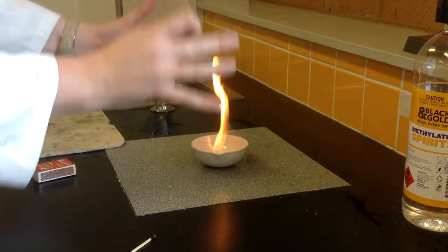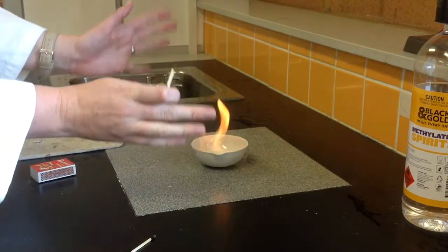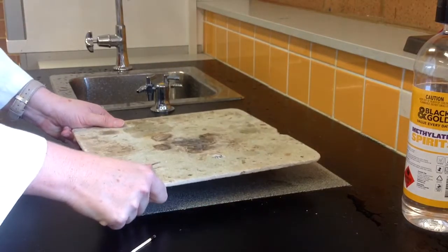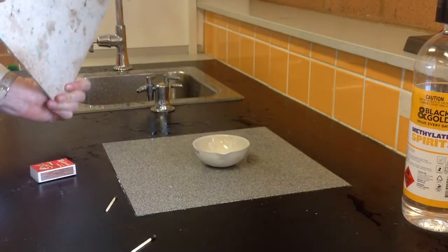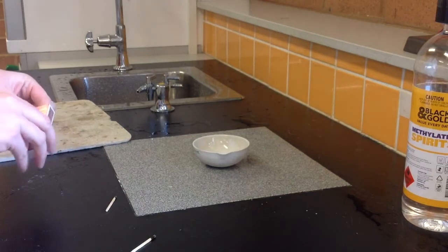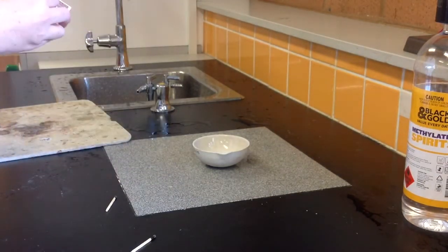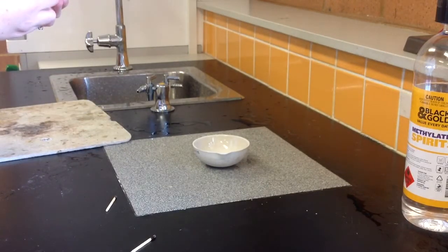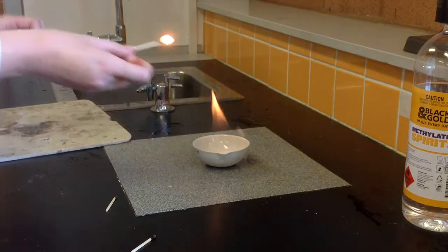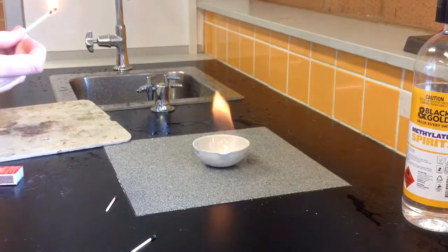This is still a hot flame, but not nearly as hot as our Bunsen burner on the blue flame. It's warm enough, but if we get a heat mat we can easily use it to smother and put out the fire. We were careful not to touch it, but we let it burn because it's fun to see. All the while, the chemicals in ethanol — which is the main part of methylated spirits — are being turned into water (H₂O) and carbon dioxide (CO₂).